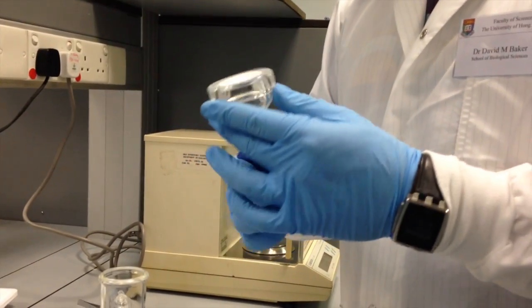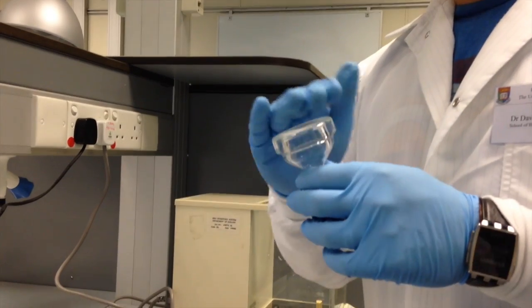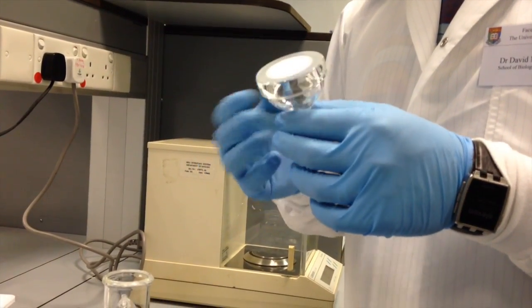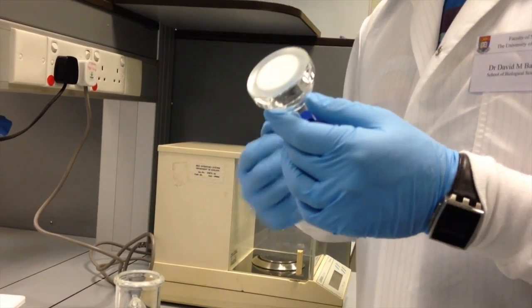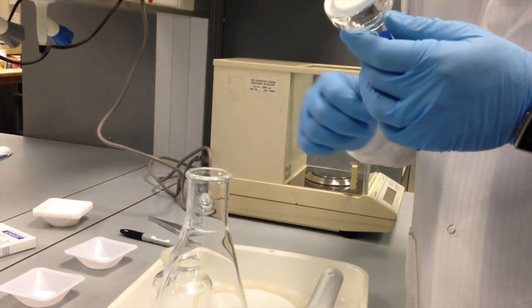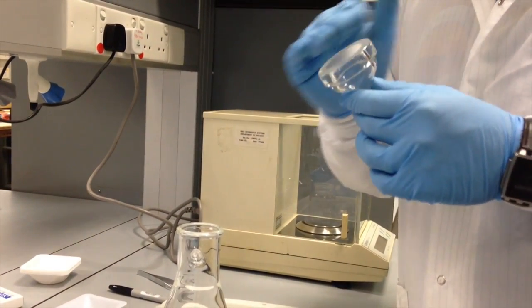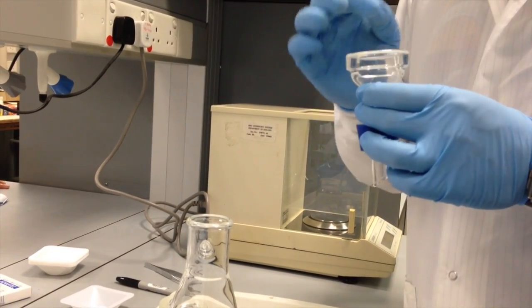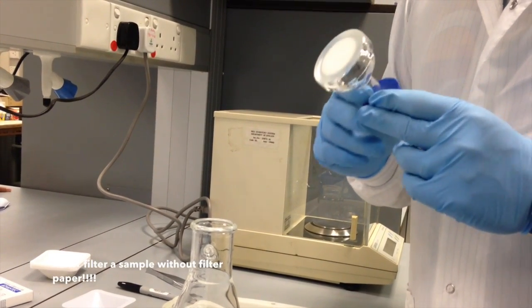We also have this fritted glass filter. This is not what you're going to be filtering anything through without having a filter paper on top, but this allows the vacuum to be applied evenly to your water sample so that it's drawn down into the flask during the process of filtration. But remember, nothing should go through this without a membrane filter or a glass fiber filter on the surface, because if you embed this with particulate matter from your sample, it will be ruined.